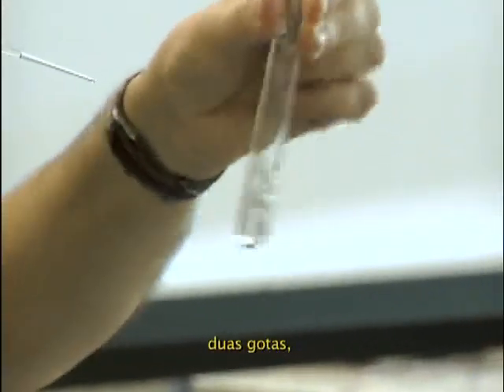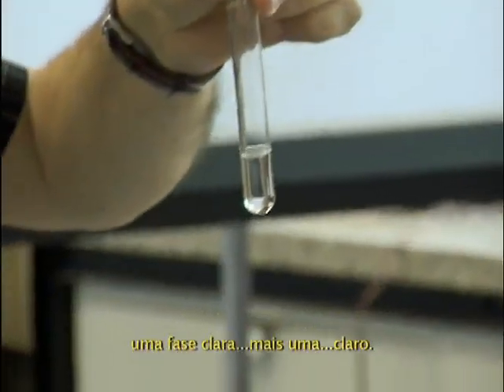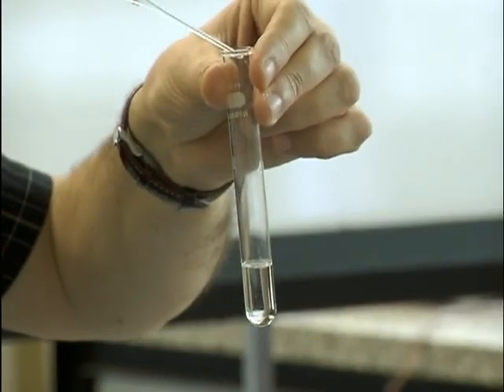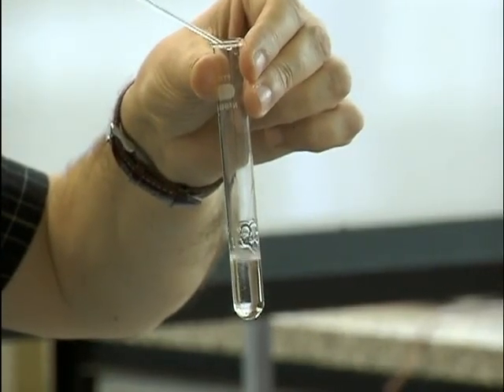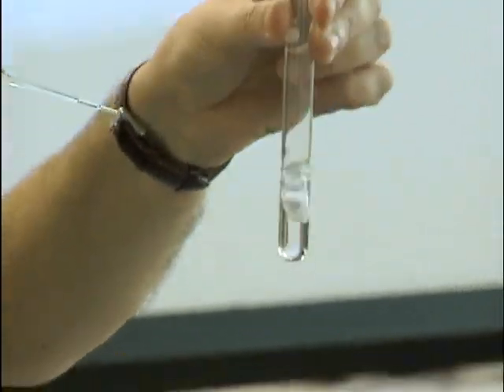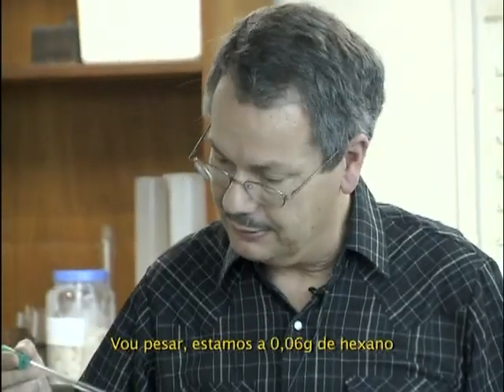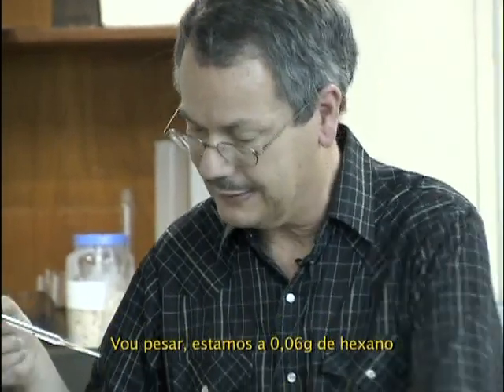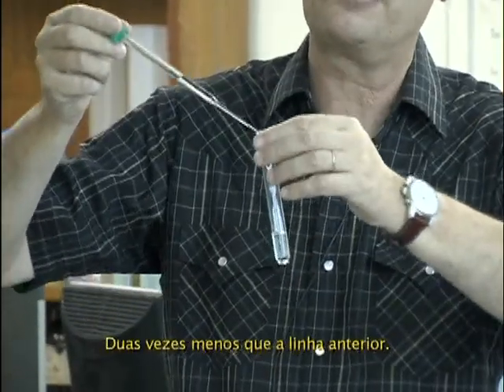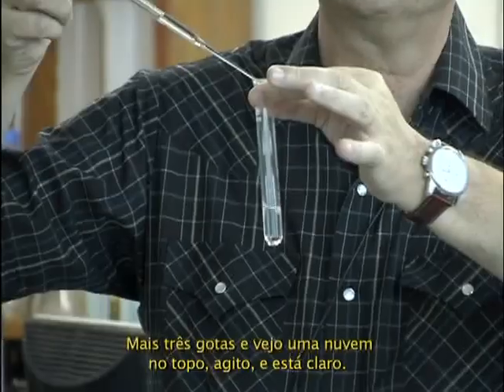2 drops. 1 phase, clear. I hope you see it. I think on the screen you see less than in real. I'll put 2 more. Clear. I can wait to have the gram amount I put. I am at 0.06 gram of hexane. So it's already 2 times more than we did the previous line. I go on to 3 more drops.